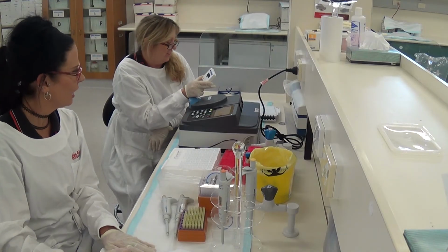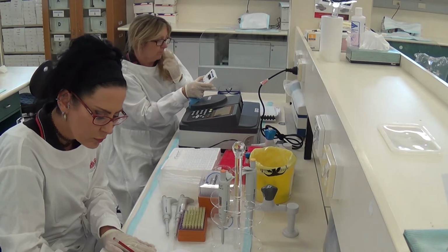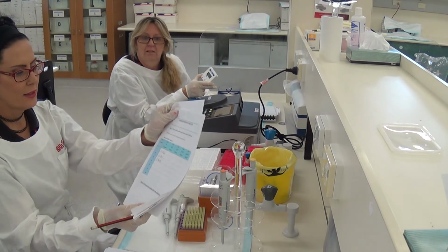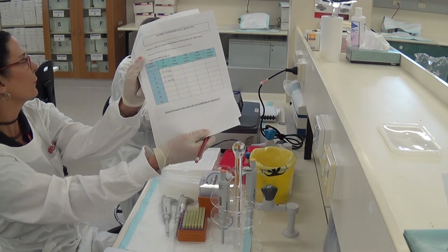58, 59. 0.405. There we go for the kids watching at home. So that's how we're going to fill this table in.